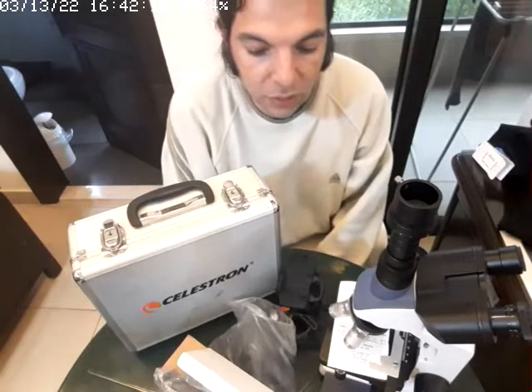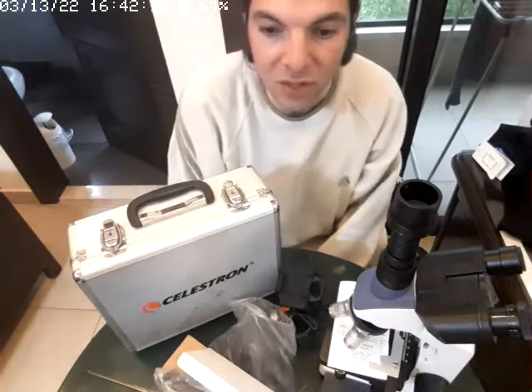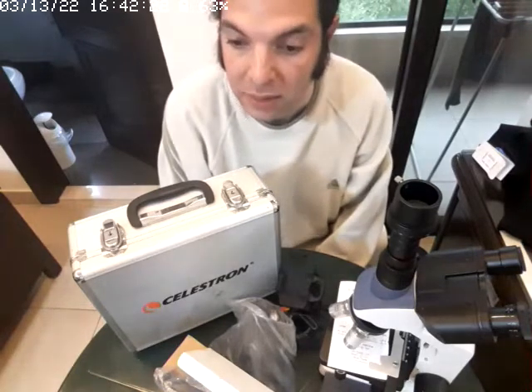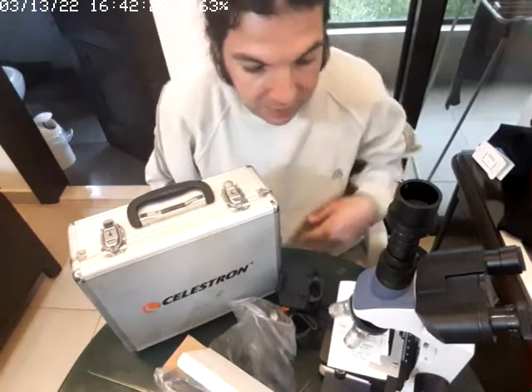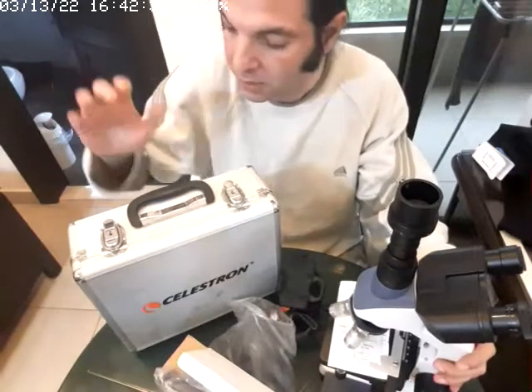Now, in this video, we're going to show you how to use microscope filters, but this time I'm not going to use the actual microscope filters usually used, because what I'm going to do is optimize this. I'm going to let you use the filter slider of a telescope. Why? Because this is what's going to happen. This is a microscope here. This is my telescope.